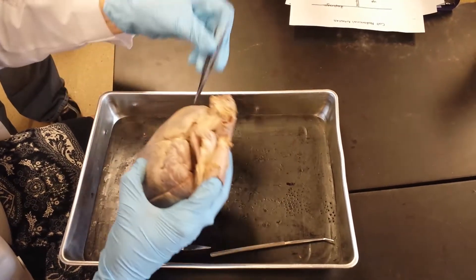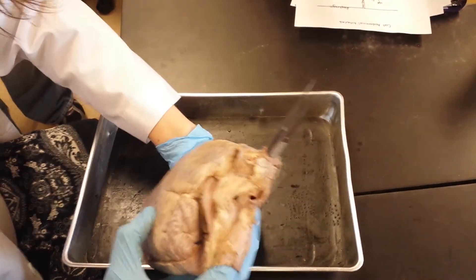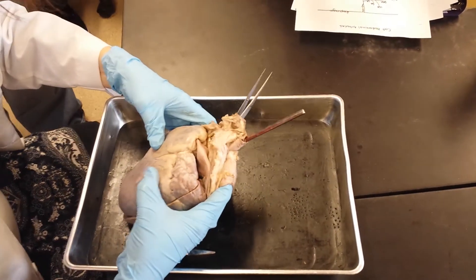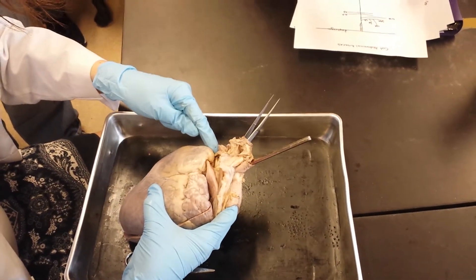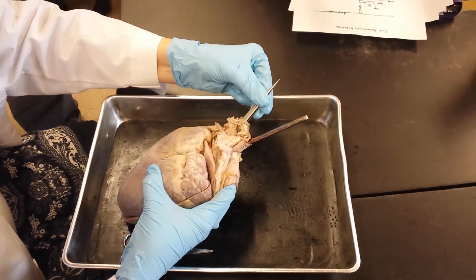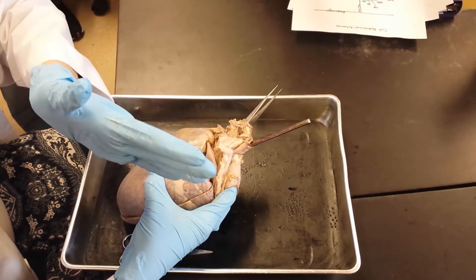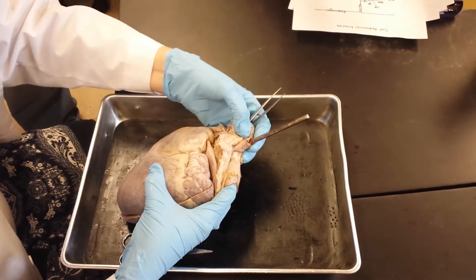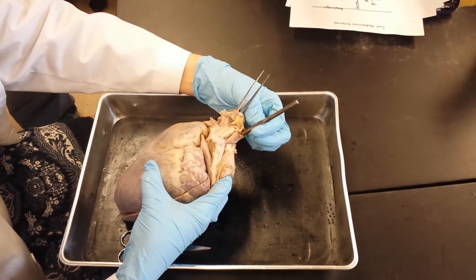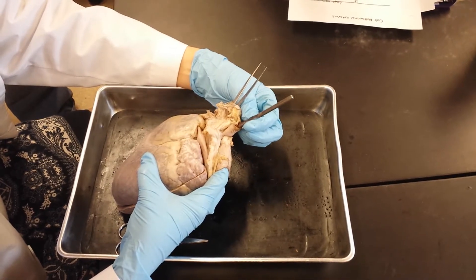In the cow heart, we have two branches off the aorta. The first one, as it comes off the heart, is our brachiocephalic artery — make sure you put both 'brachiocephalic' and 'artery.' The second one is the left subclavian artery. You'll see why when we go through blood vessels today.